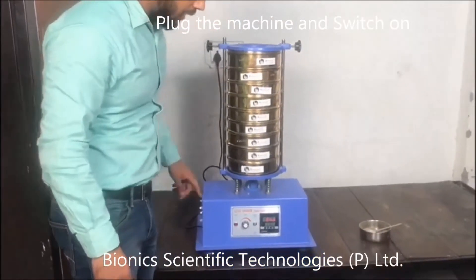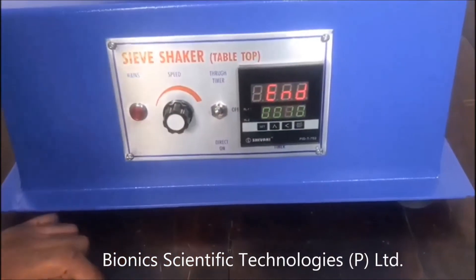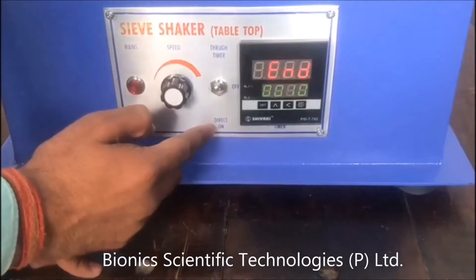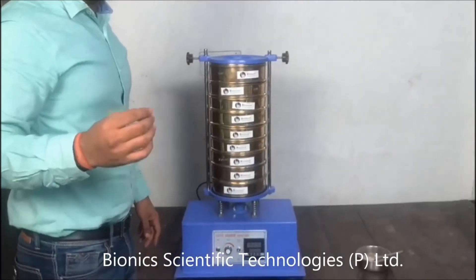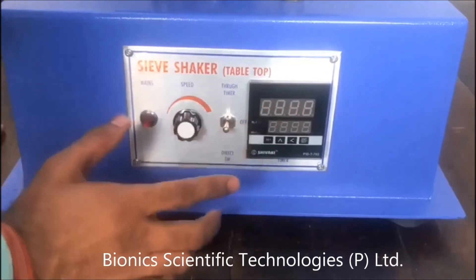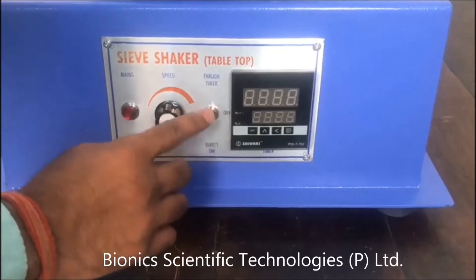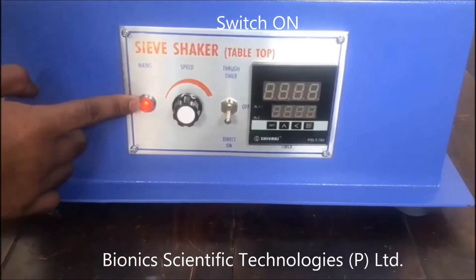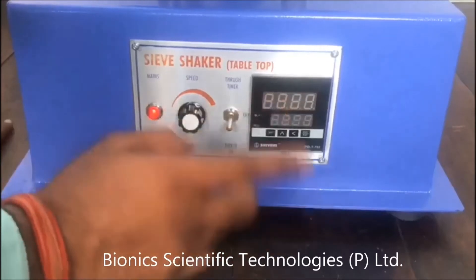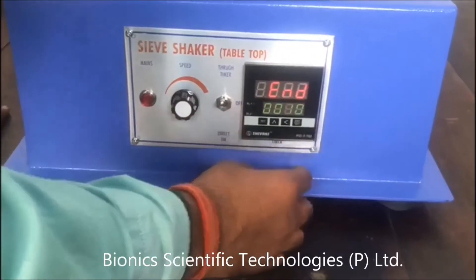First you will plug in the switch and then switch it on. As you can see, this is the PID controller and this is the main switch. The machine works through the timer. This is the main button through which you can turn the machine on or off — right now it's off. Now the mains switch is on, which shows that the machine is ready to work.